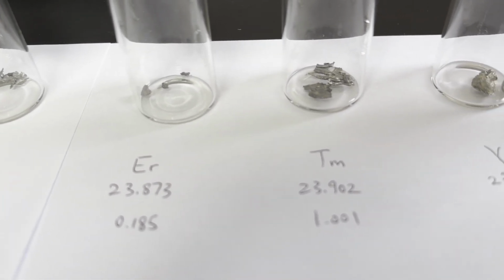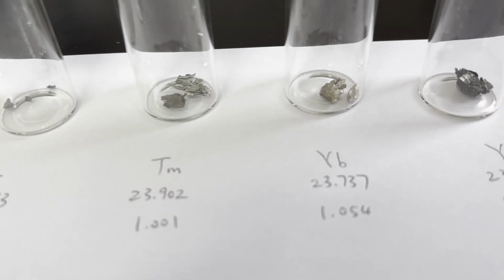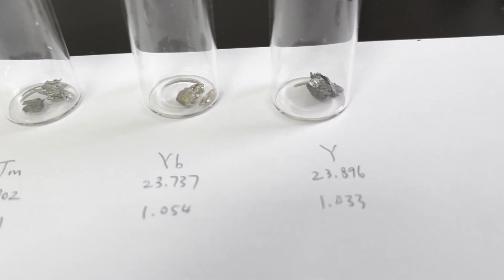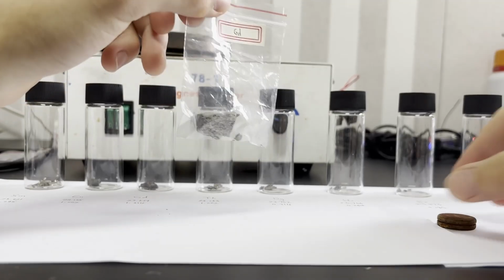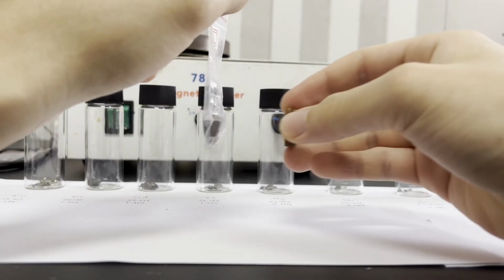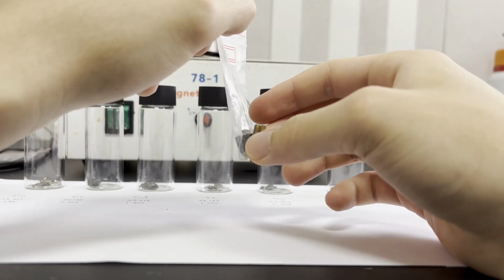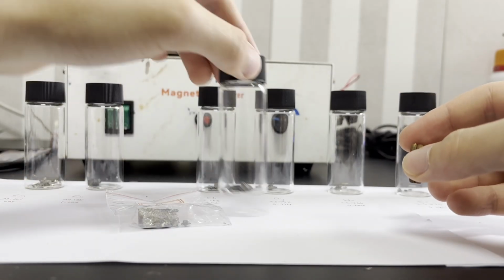Anyways, you can see that I got considerably less holmium and erbium samples than other metals, and the samples of europium, terbium, and thulium weigh very close to 1 gram, while all the others are slightly off but not too off. The reason for this is actually not just because I'm lazy to weigh out 1 gram of each metal, but instead it is very interesting and relates to the cost and properties of rare earths, which I'm again pretty sure nobody else has talked about on YouTube.